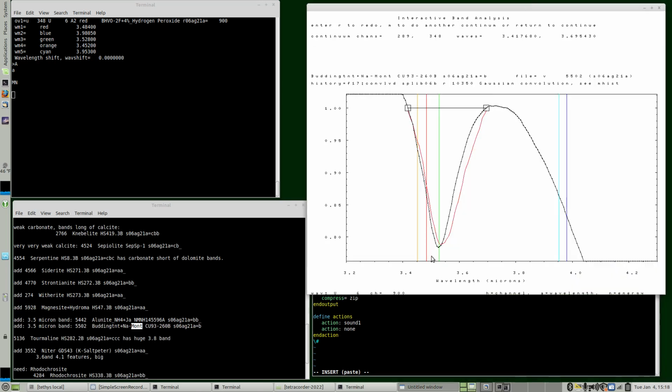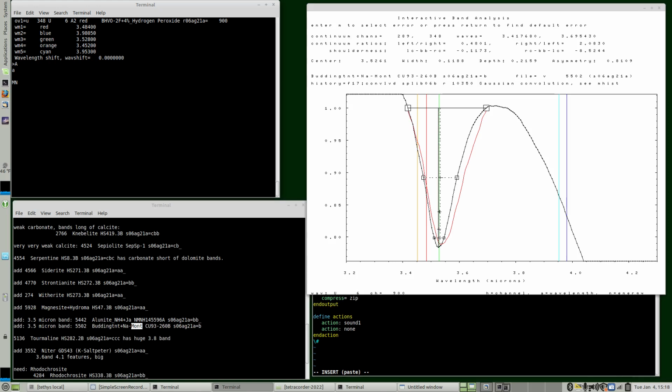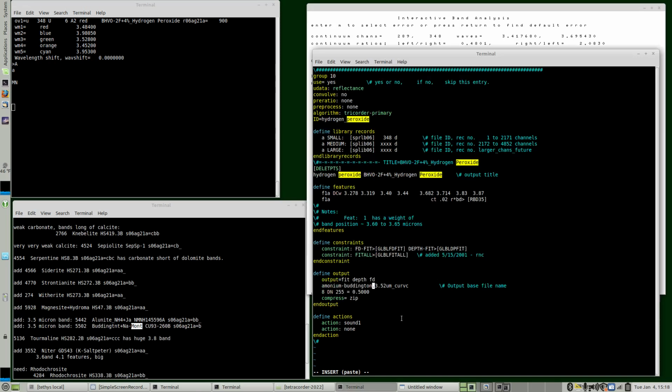And then let's look at the band position. So we didn't quite get that yet. So it's again 3.526. 3.52 is close enough. Oops. Okay, so we have that. Then let's come up here and change the ID to something like that.